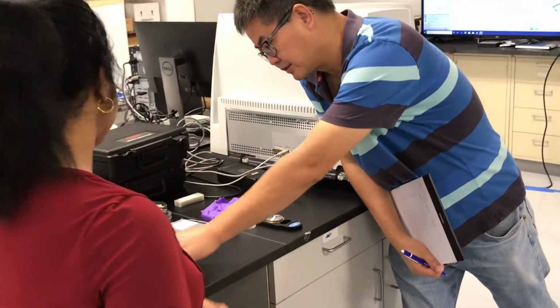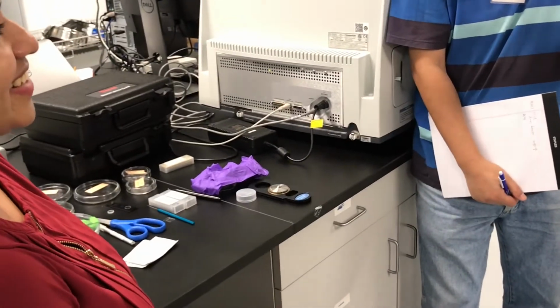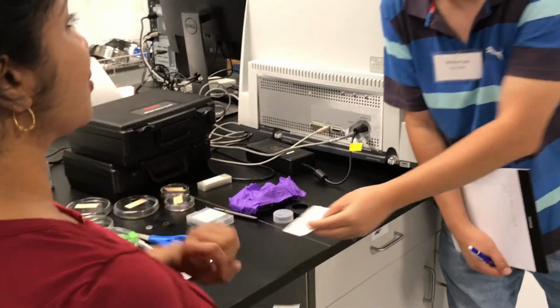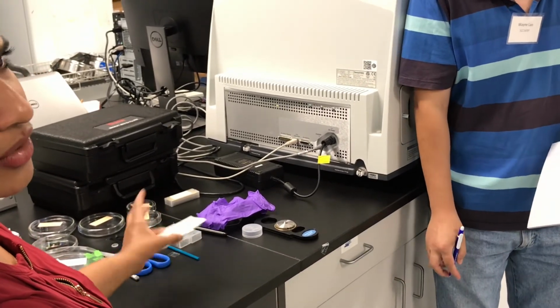So this is just bought from CVS. Yeah, this is just from CVS. Yeah, the high quality CVS. Actually, Amazon one. So that box, the Medline box, is from Amazon. That's like $5 for 100, and this is I think like $7 or $8.